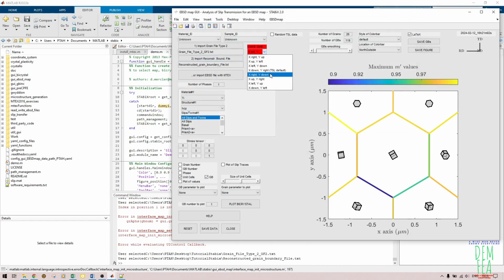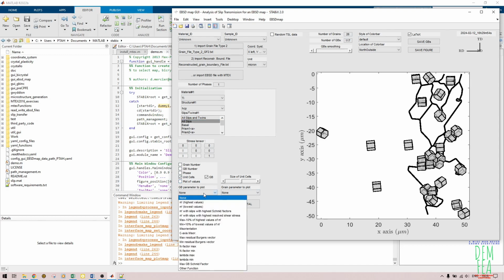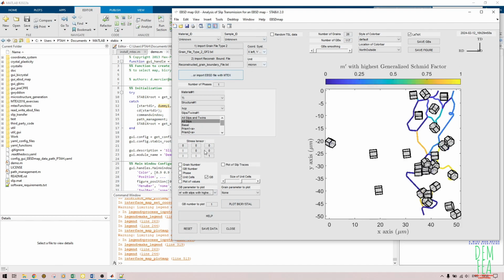And then after that, we come here and then I put my coordinate like that. As you can see, now I have my crystal structure. As you can see, it's HCP. So as you can see, this is how it looks like. So this is very important. For example, if I want to come here and investigate maybe the slip, you will see the effect of the coordinate system and also the stress tensor. These things are very, very important.